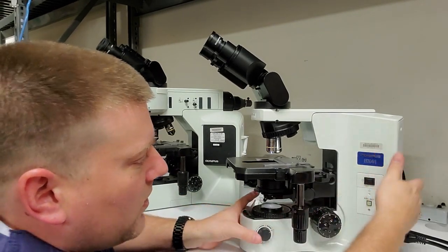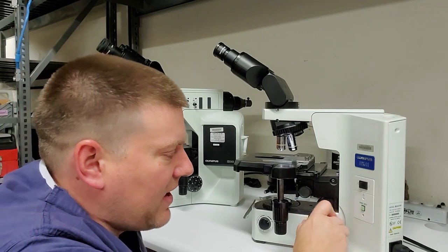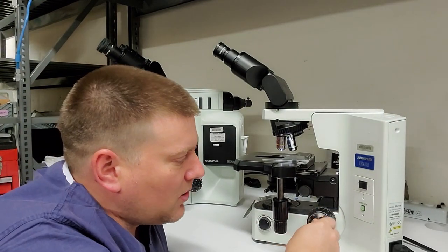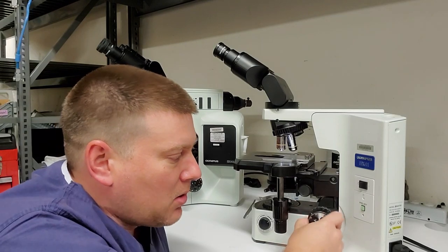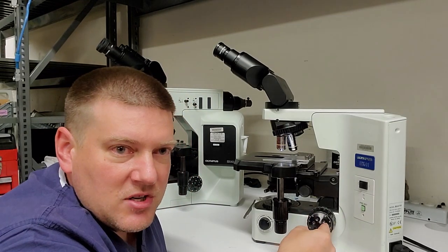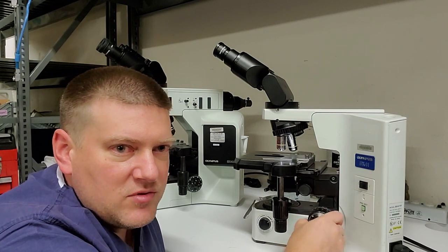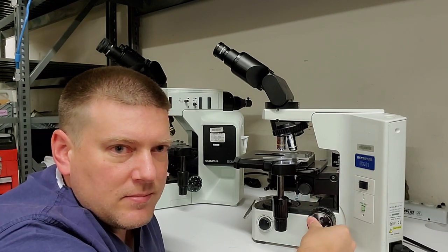One of the other things I want to point out to you guys is right back here is your stage adjustment knob. You see that? There's going to be a macro adjustment and a micro adjustment. You see that? That's micro. This one right here is macro. You see how the platform moves drastically versus this guy?